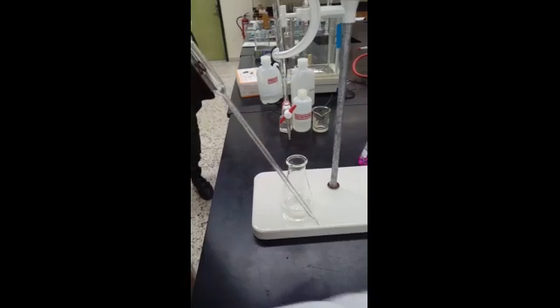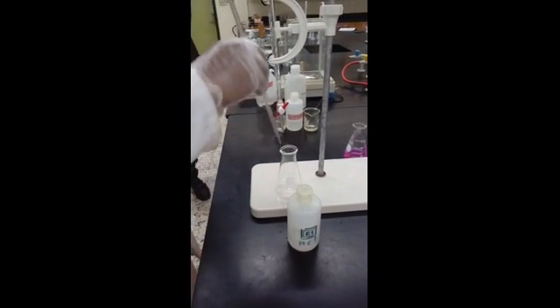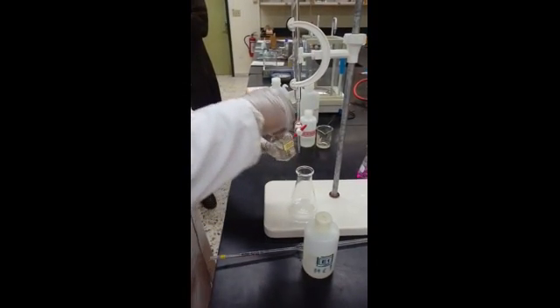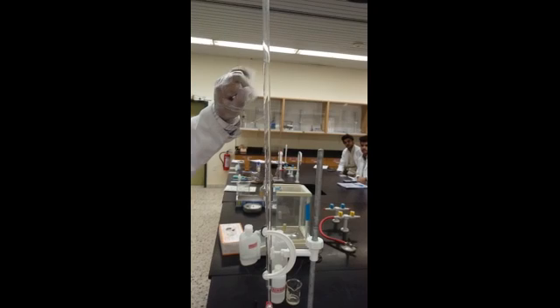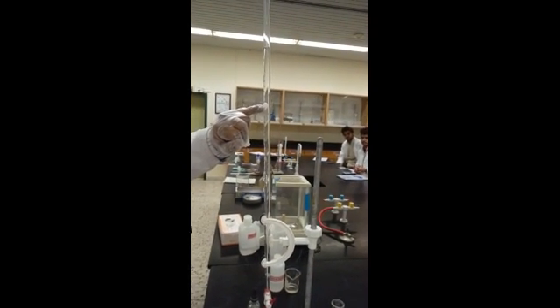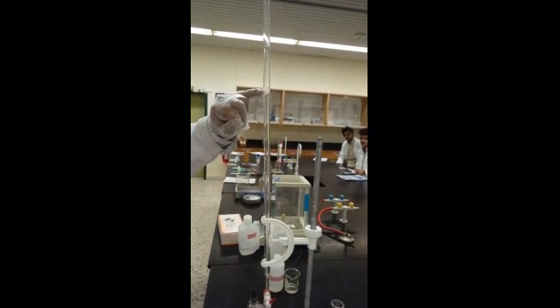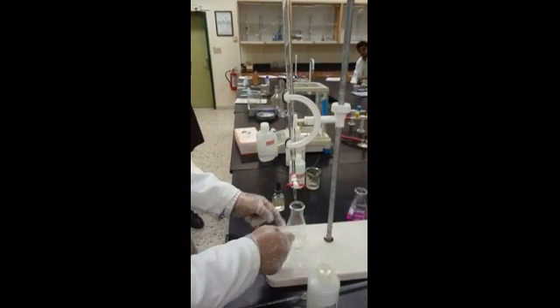Take the acid 20 milliliter from the sample bottle and put the acid 20 milliliter here. And then you put 3 drops indicator here, and then again start the titration. Where do we start now? From the end point here, 7.6. We know 7.6, it will go to around 14. So we go fast up to 13, no problem. Then from 13 drop by drop. And we get the color change, we stop, and then we take the reading.